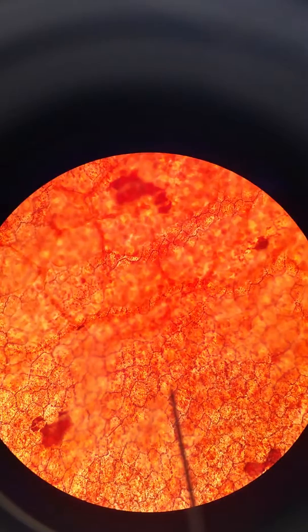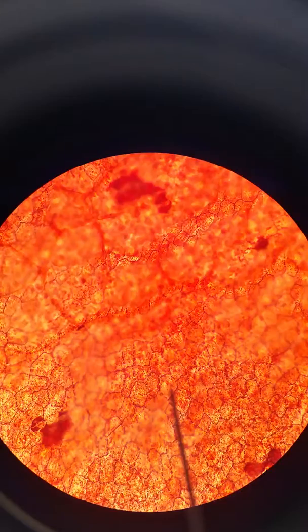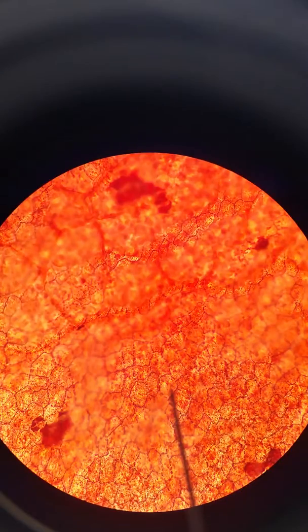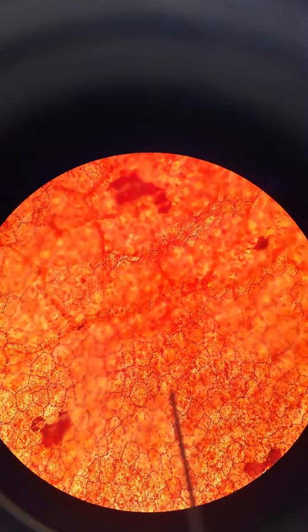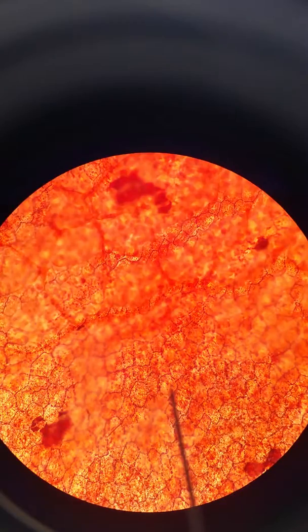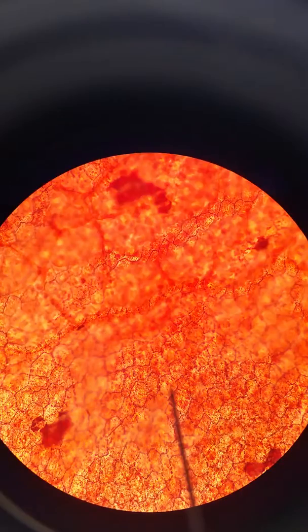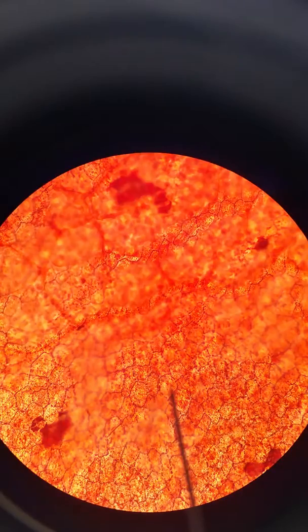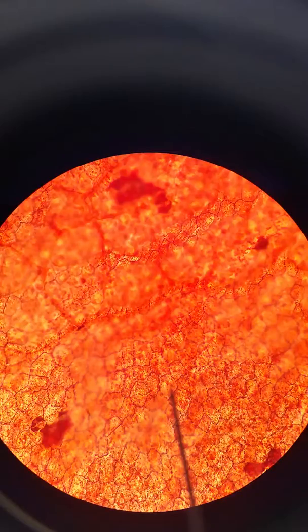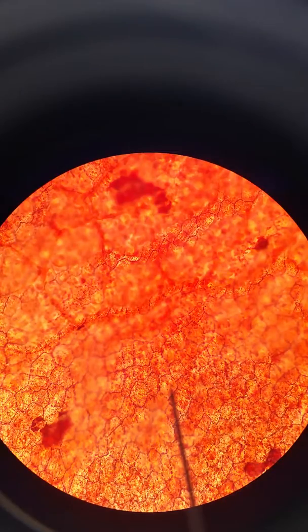The cells have no distinct shape — they're kind of oval, kind of round, a little bit free-form. It's not like there are squares or columns or anything like that; the cells are definitely a free-form shape. And that's our example of simple squamous epithelium.